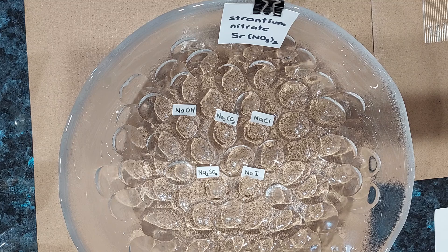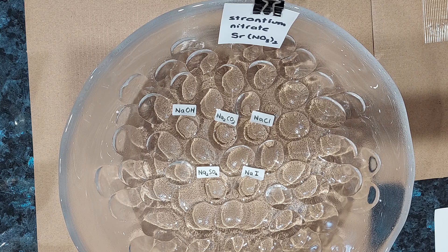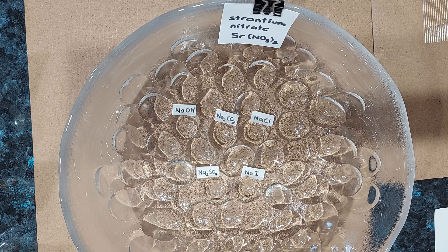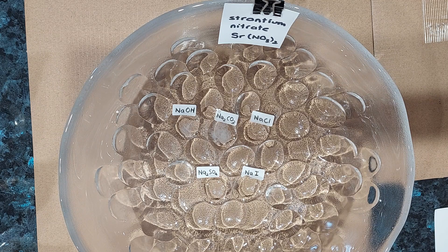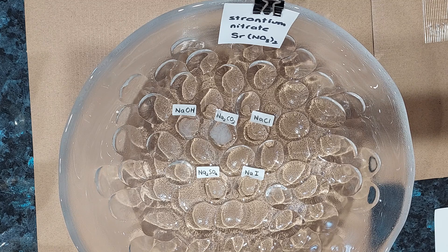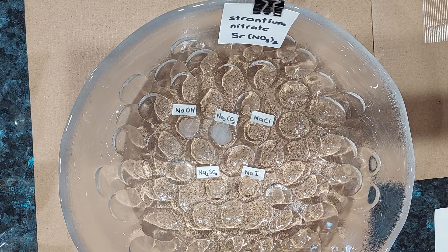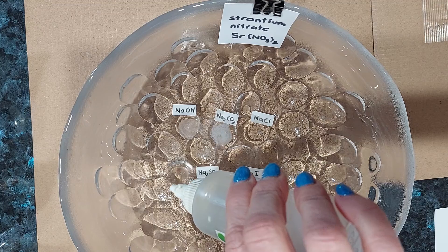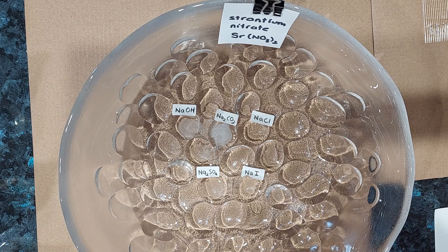The next nitrate we are going to try is strontium nitrate. I've cleaned off my salad bowl and refilled the dimples with the sodium salts. With sodium hydroxide and sodium carbonate, both are making a precipitate at the same time. With sodium chloride and the others, we get no precipitate — so we've got a precipitate with sodium hydroxide and sodium carbonate but none of the others.